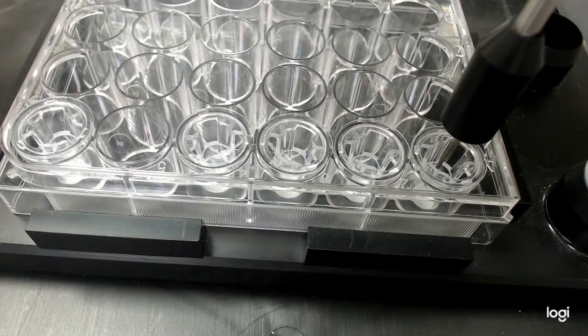I'm going to go to the other wells as well and explain. I'm changing the setting, so it will take a minute. I go to the next wells right now. I go to reset one. And I'm going to reset 1, 2, 3, 4, starting from 1. And I'm going to run the REMS system and see what happens.